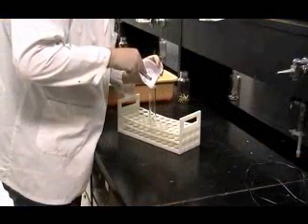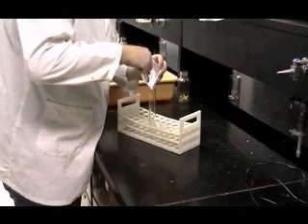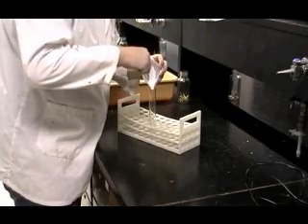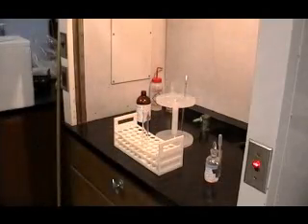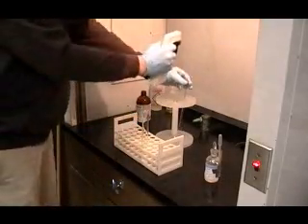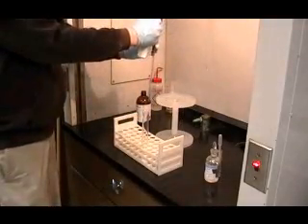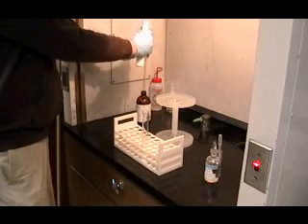Transfer your salicylic acid to a clean, dry, 20-centimeter test tube. Next, have your instructor or laboratory assistant dispense exactly 5 milliliters of fresh acetic anhydride into the test tube.